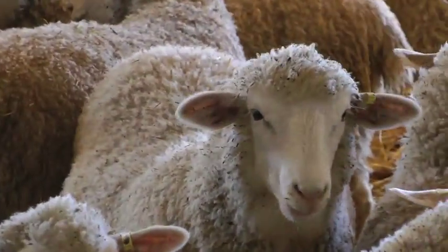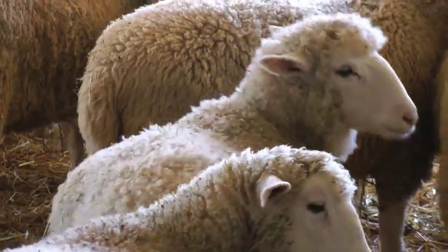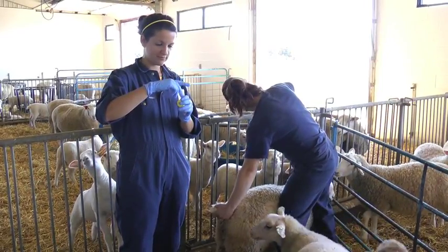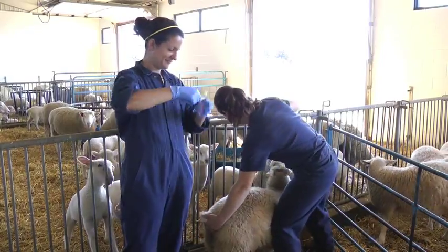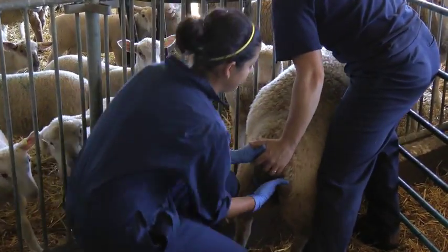Keep in mind, you shouldn't sample the first 10 animals that you come across, but instead, select the animals randomly from your flock to ensure that they are more representative of the group. To collect the samples, apply a small amount of lubricant on your gloved fingers. Insert 2 fingers in the animal's rectum and gently tease out the fecal pellets. If you aren't able to collect any samples the first time, try again after about 10 or 15 minutes.